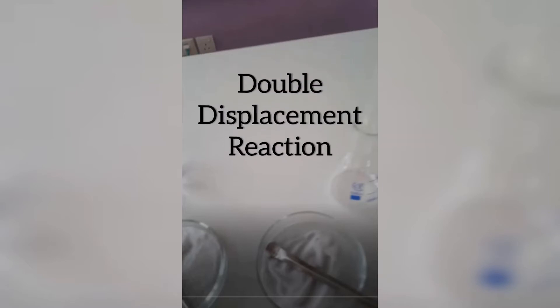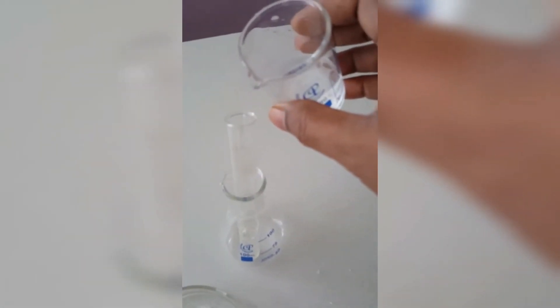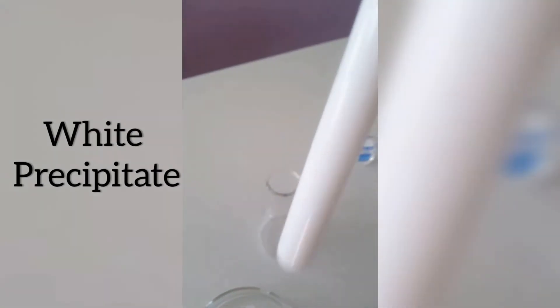This reaction is an example of double displacement reaction. Now let us observe what will happen if we mix these two aqueous solutions. I have taken sodium sulfate in a test tube and I am going to add barium chloride into this sodium sulfate. What is this white color precipitate about?